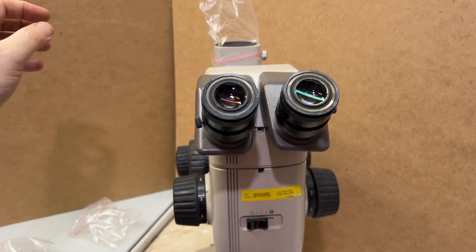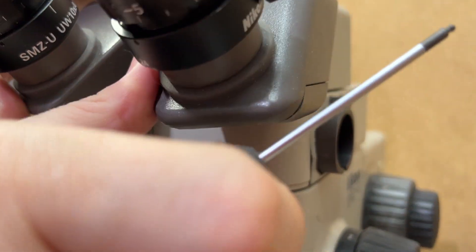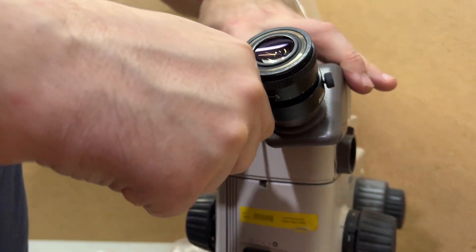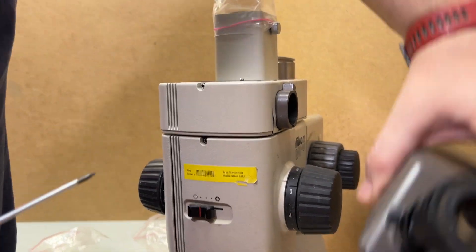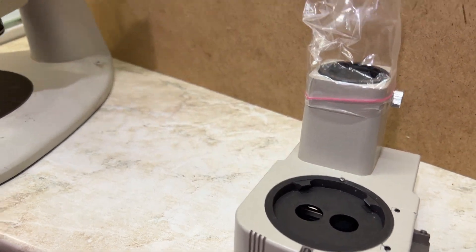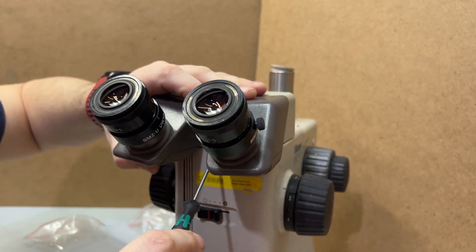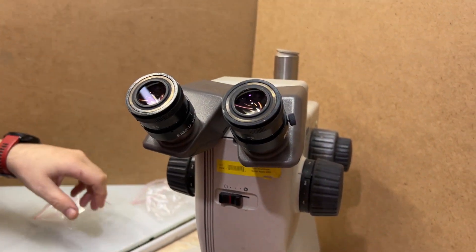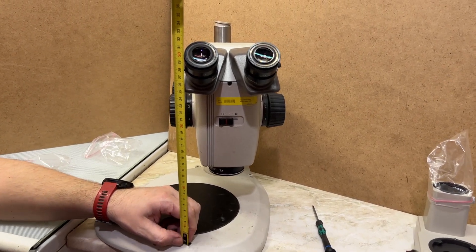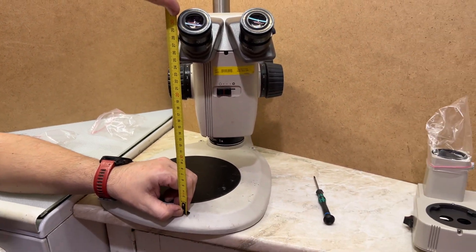If we try to take our photo splitter away, let's do it for those who don't need it or might be limited with height. These parts are detached as block devices. I removed one block and put our binocular head back. Now the working distance of our SMZ-U is about 30 centimeters only, maybe 30 and a half.